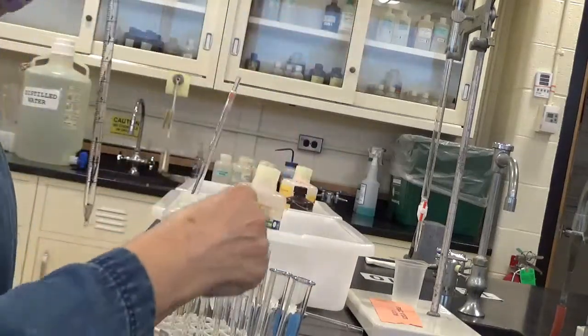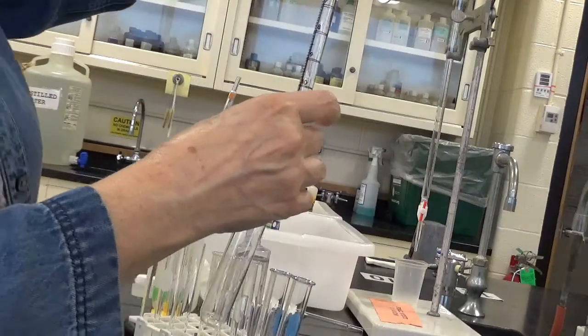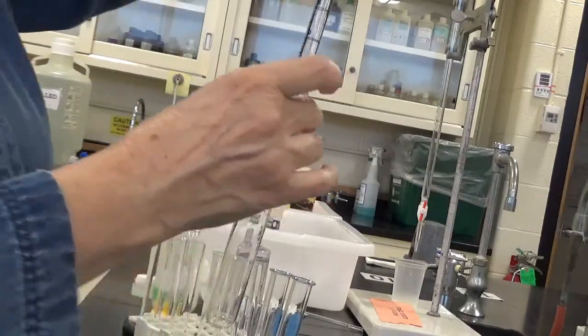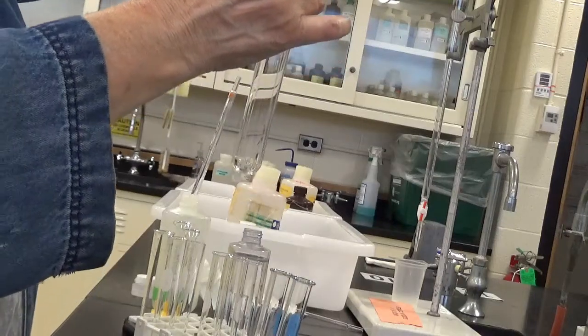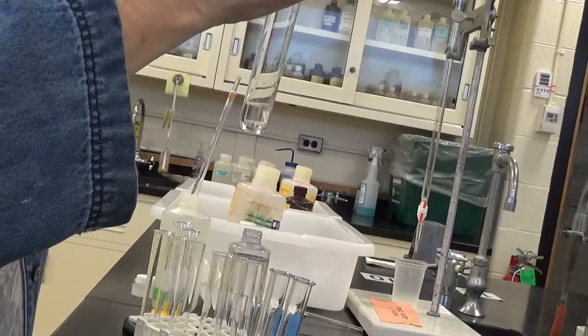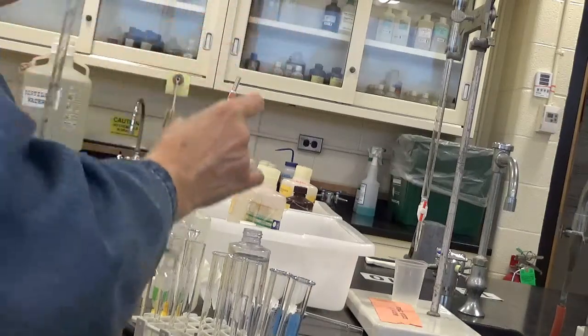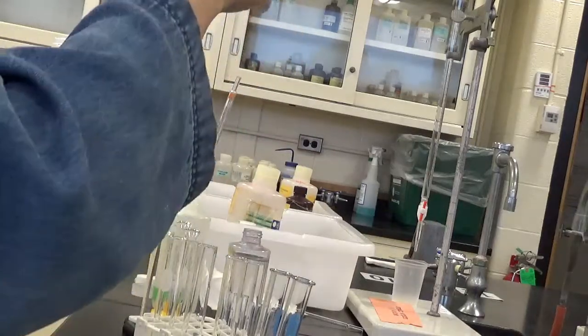So into number 4, I'm going to put 4 milliliters. I'm going to get 5.